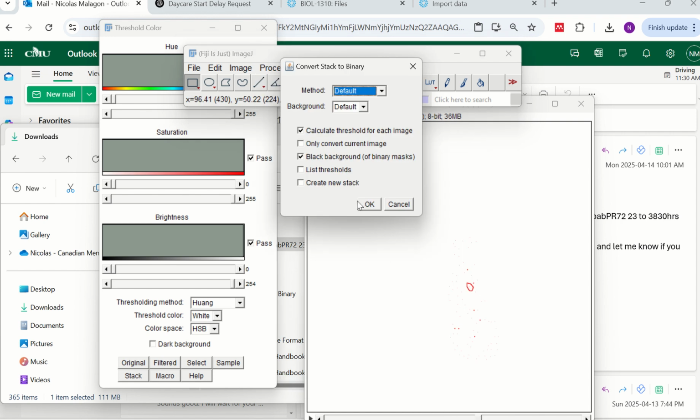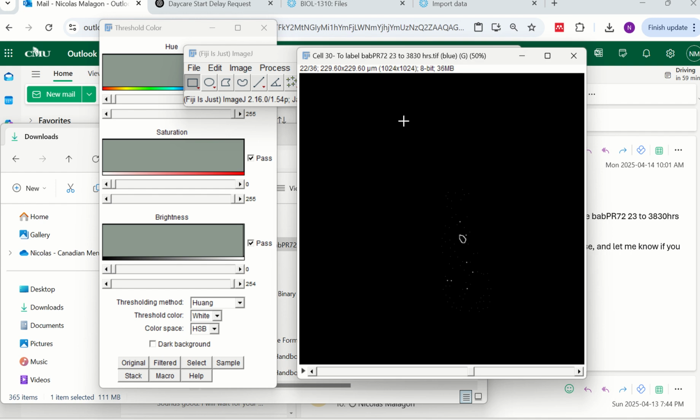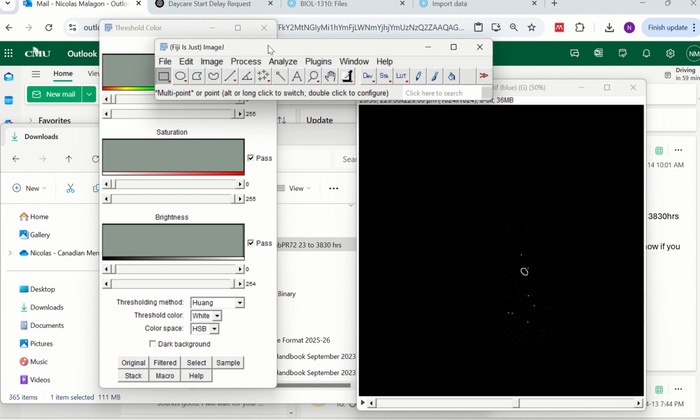Now the next step is make it binary. So you make it binary. And look, so now you have again the same points. Looks beautiful. And do you see these dots? Very important. These dots are not going to be counted. We don't need to delete them manually. We just tell the software to only measure, not measure points. Okay, those dots.